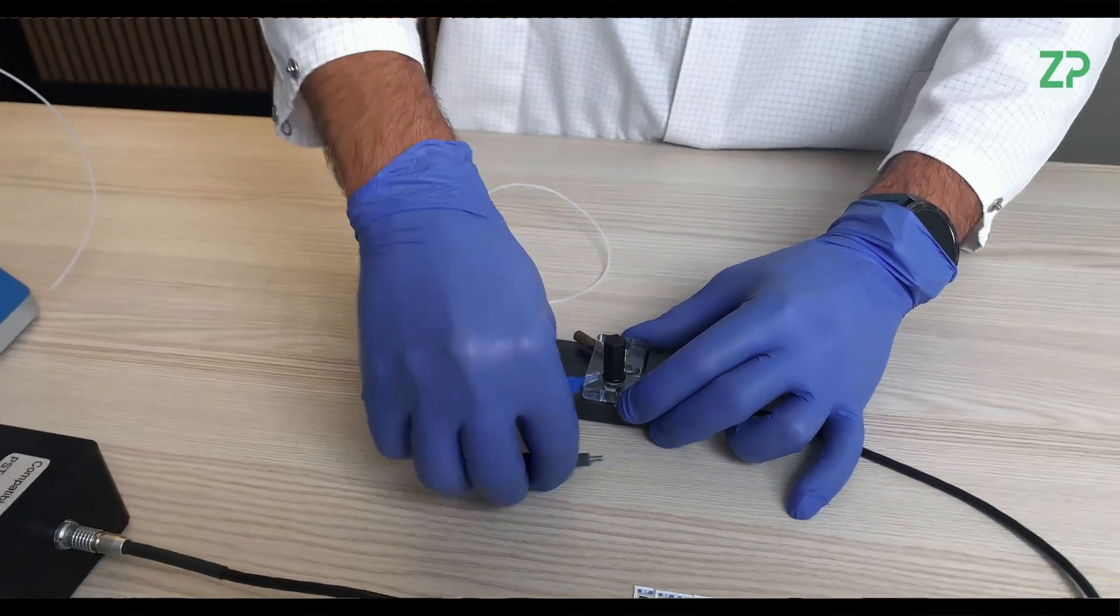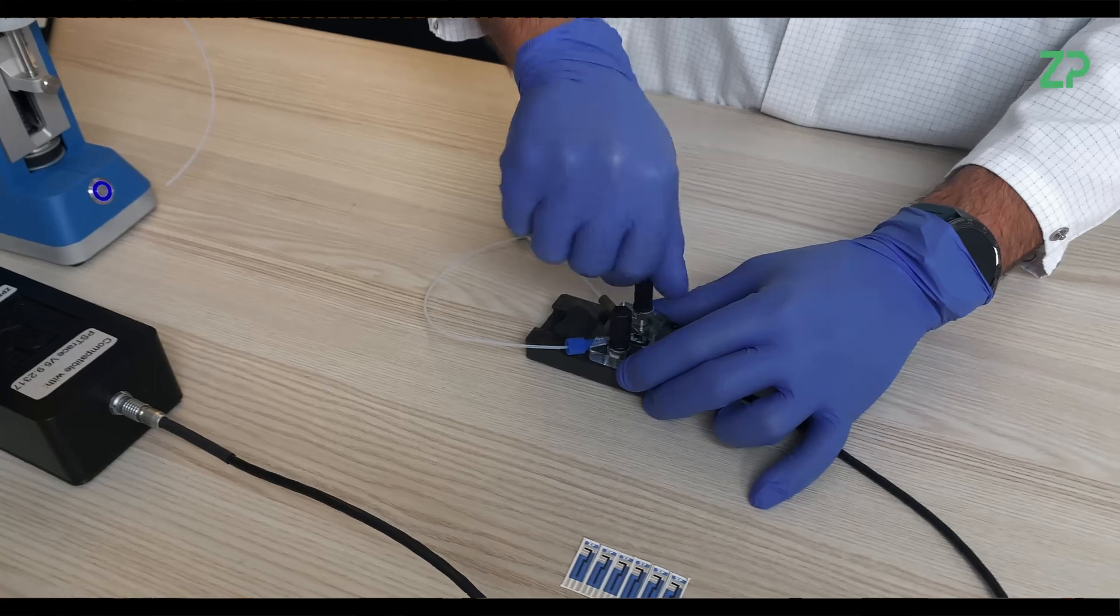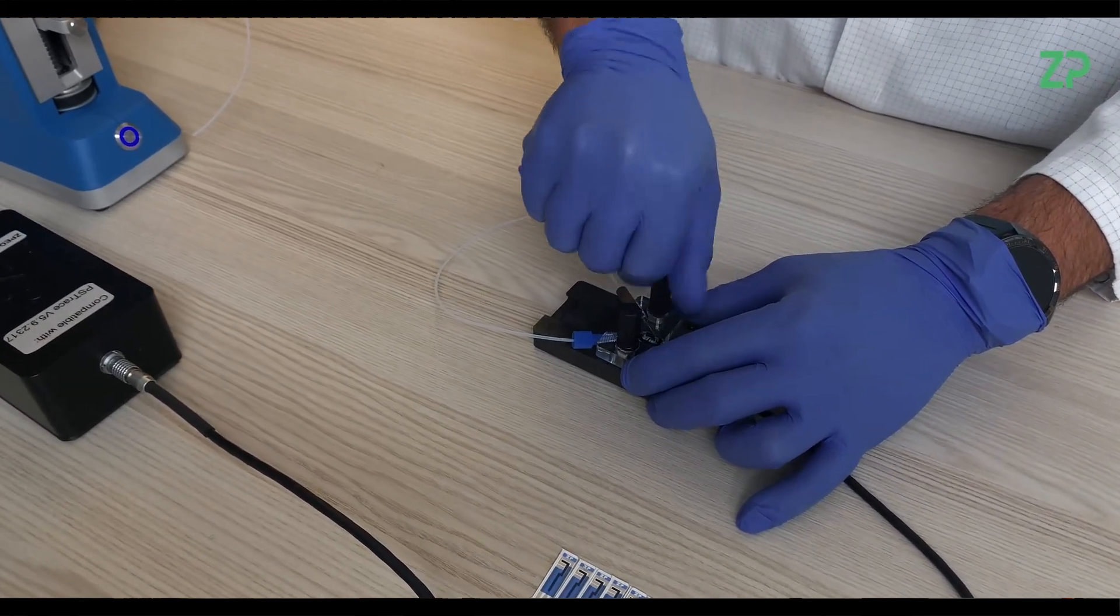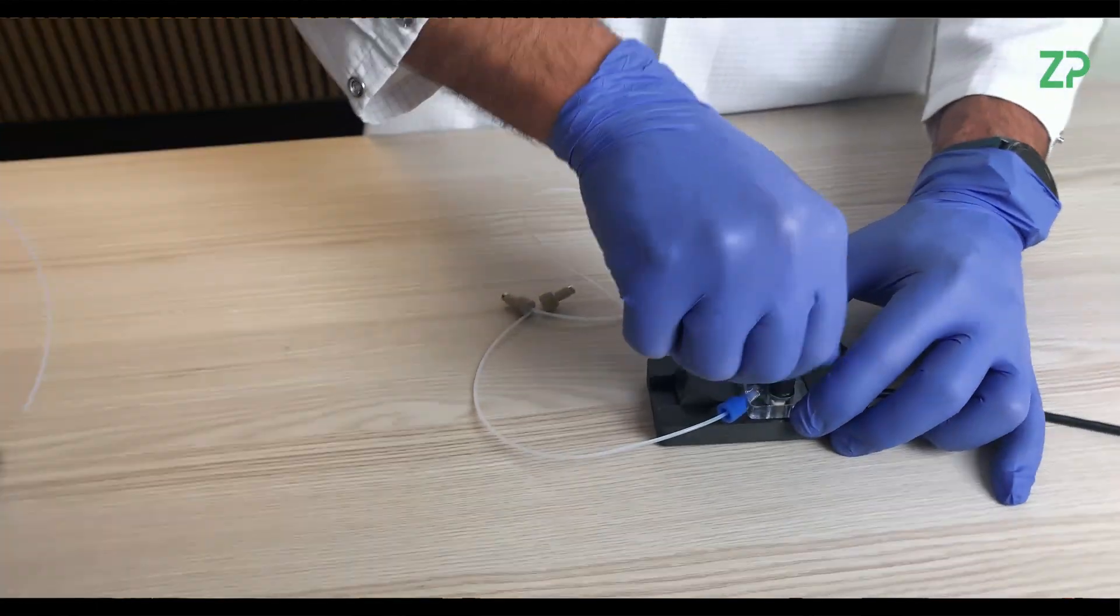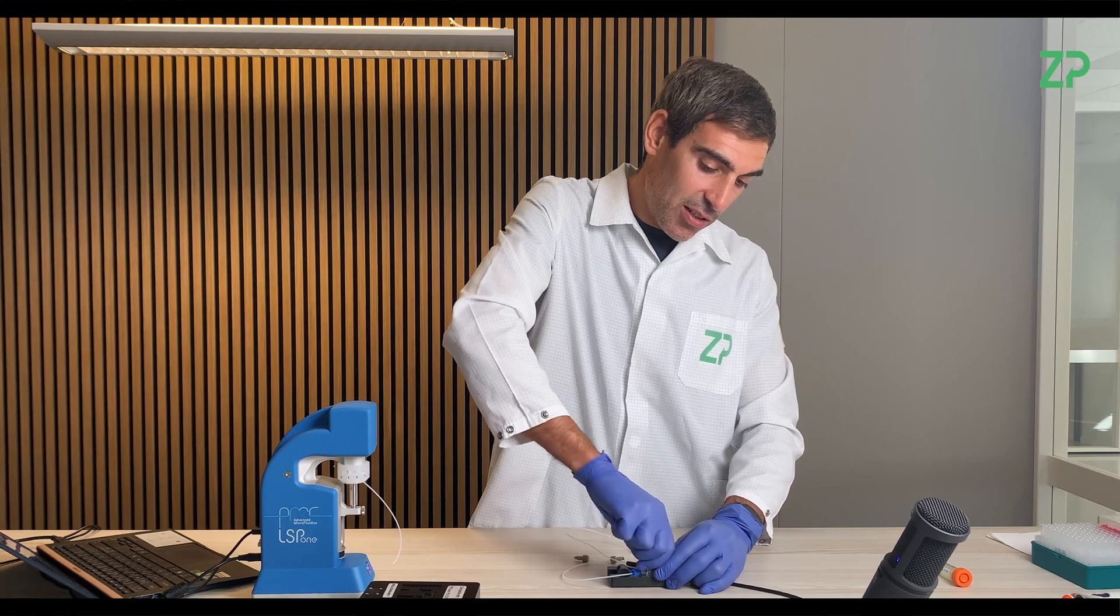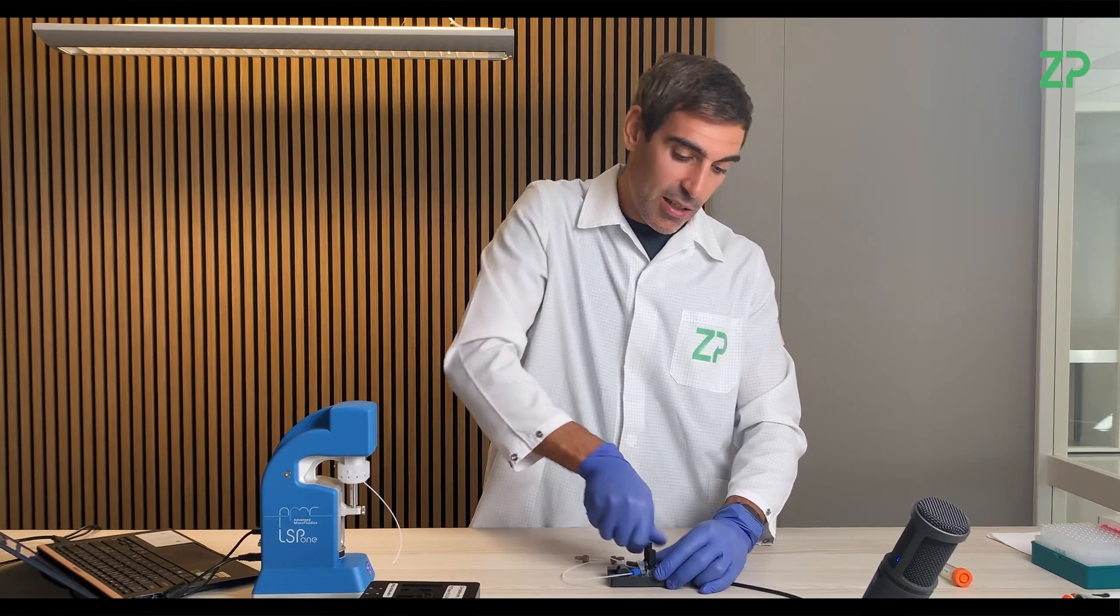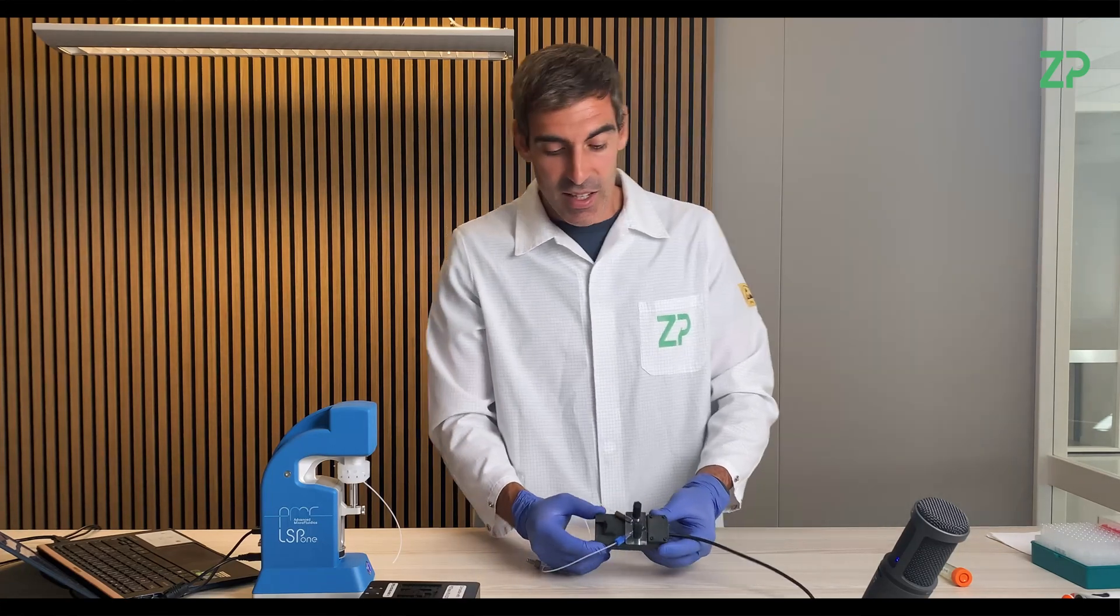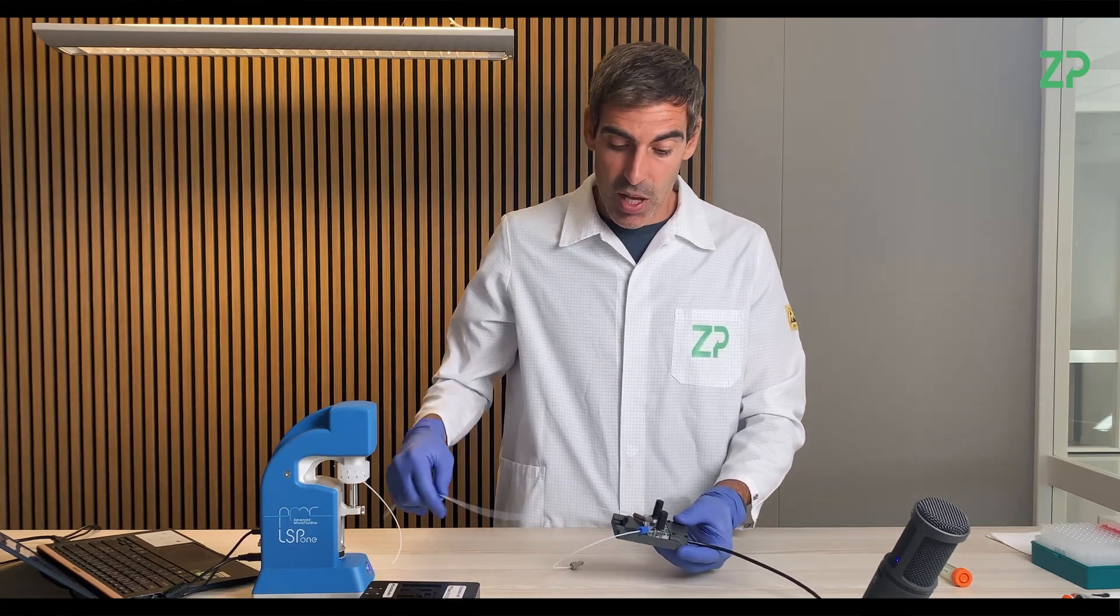And now I am putting the screws on. This has to be relatively tight in order to avoid leakage. Not too tight to the point to break it. So now it seems quite tight.